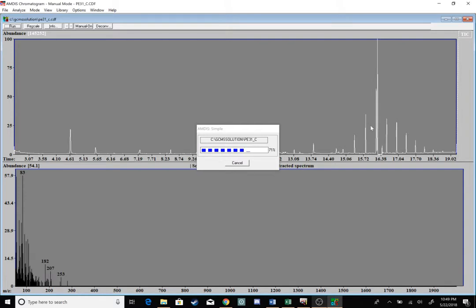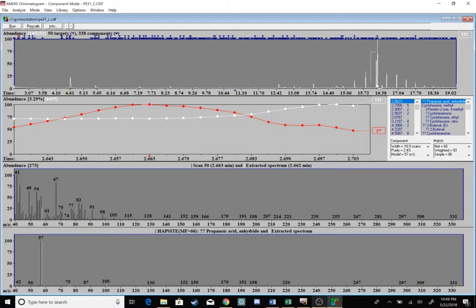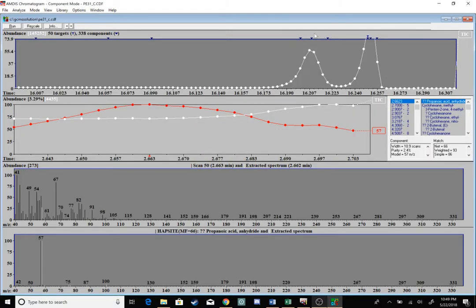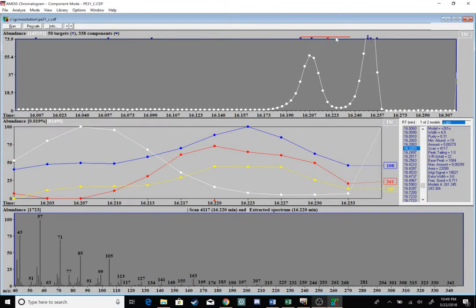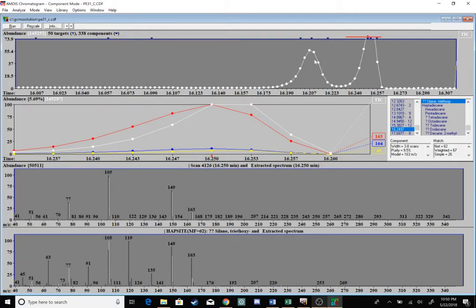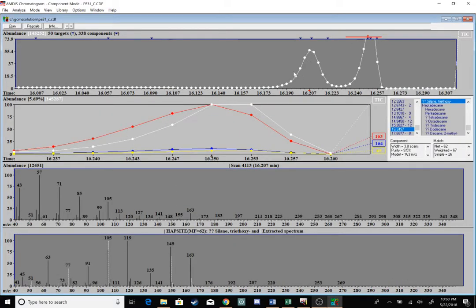So from our post-run analysis, I know I'm going to find the co-elution right about here in this peak. Once the deconvolution is done, I'm going to zoom in right here, and I want to be able to import this into NIST for further evaluation, because I don't have an AMDIS evaluation, which would mean a T, for this peak in general. So I'm going to double click on this peak. That's essentially placed a specific scan for what I'm looking at, and I'm going to import these mass fragments into NIST.